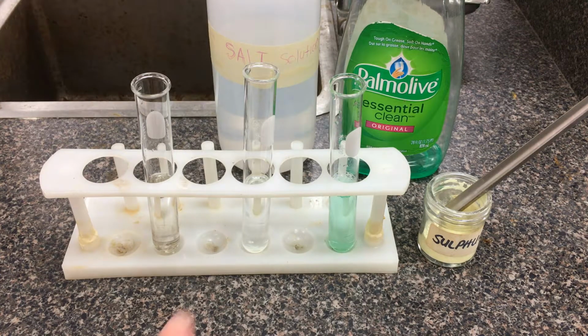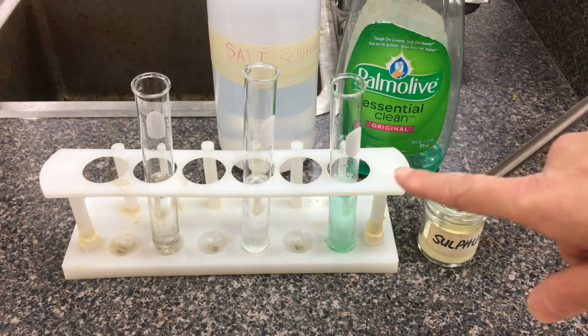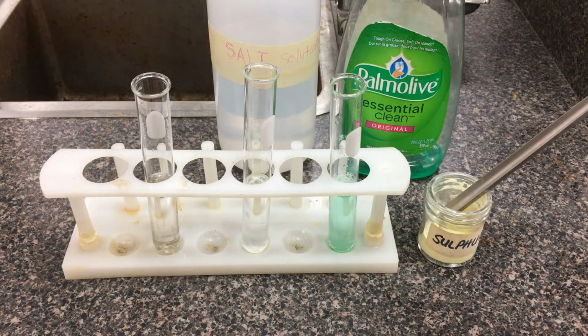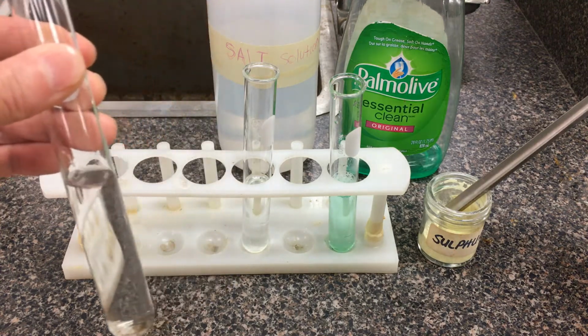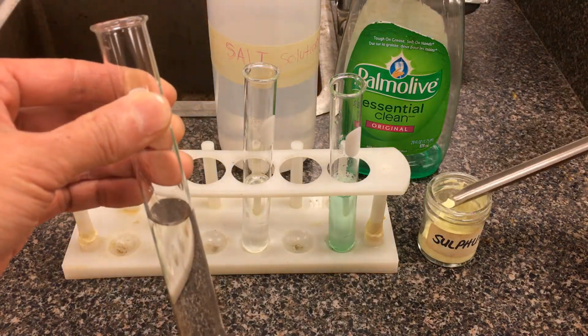If you imagine the liquid-liquid attraction at the top of this layer here, that actually ends up forming a nice film that separates the liquid from the rest of the environment. To examine surface tension, we're just going to drop in some sulfur powder to each of these test tubes respectively, and give the test tubes a tap to see how easy or hard it is to break the surface tension. This is all qualitative observations we're going to make here, but hopefully we can make a rough comparison between these 3 solutions.